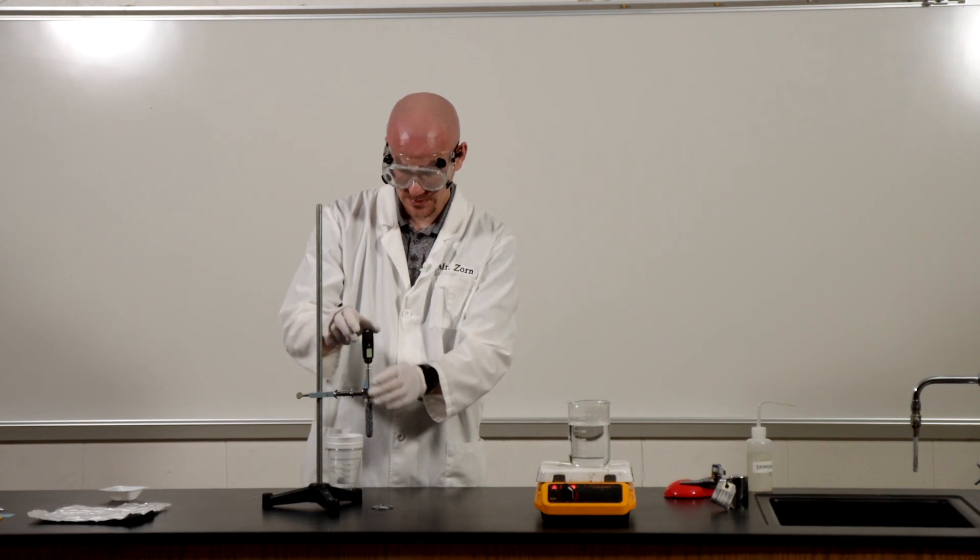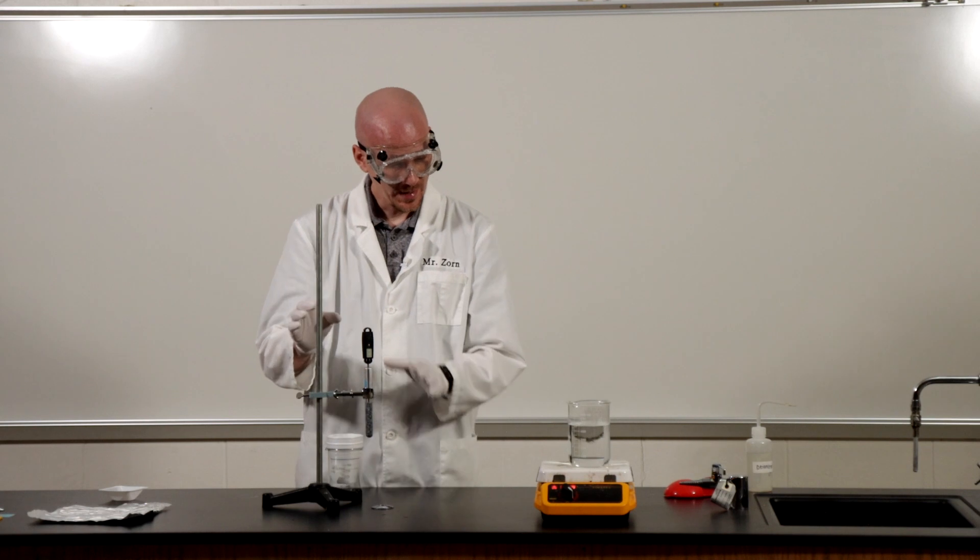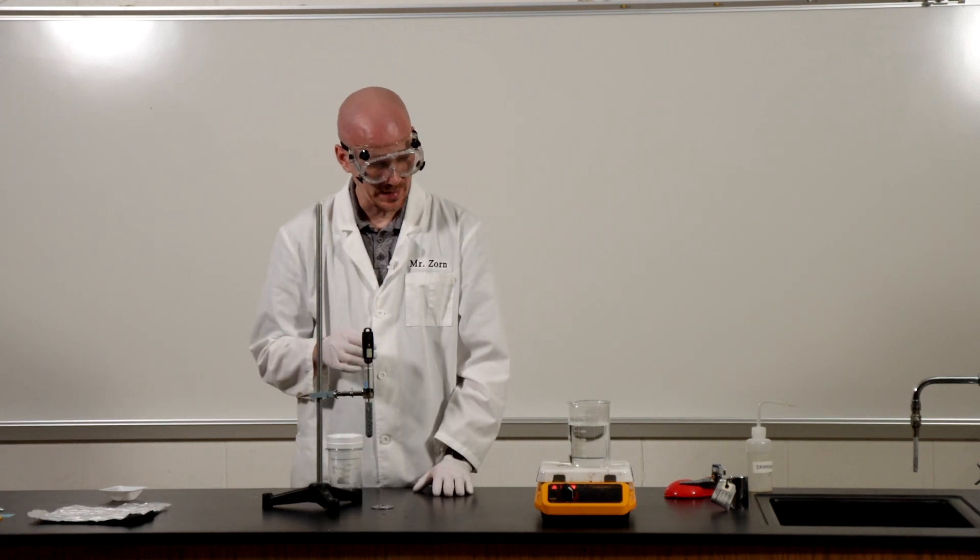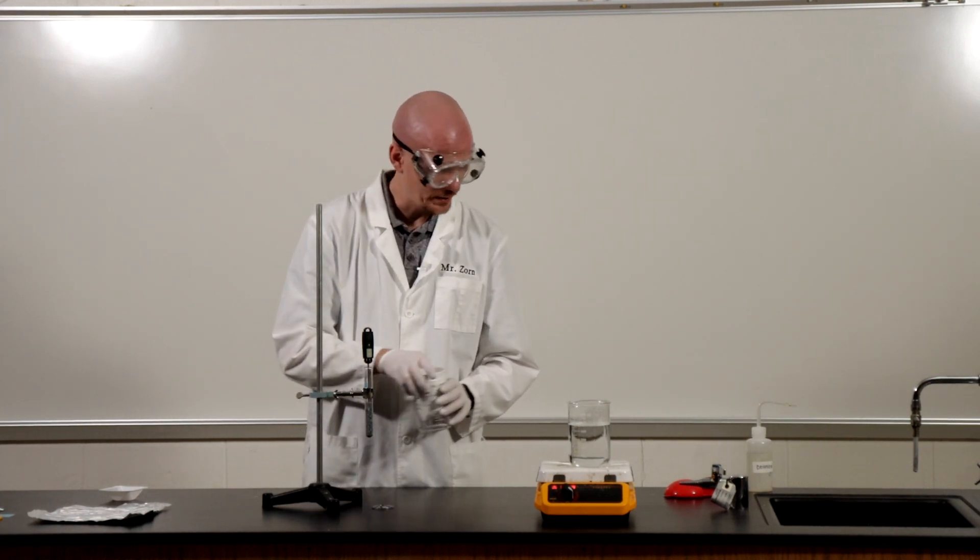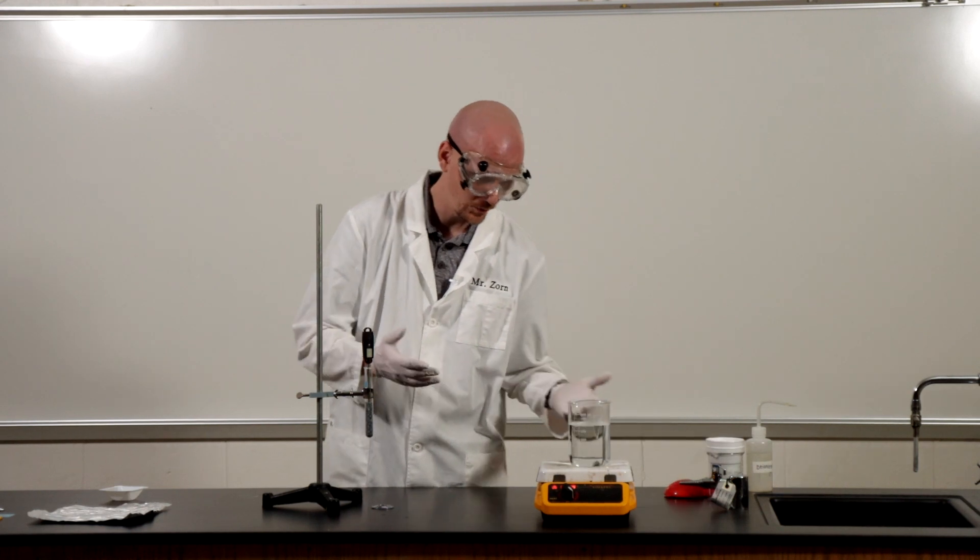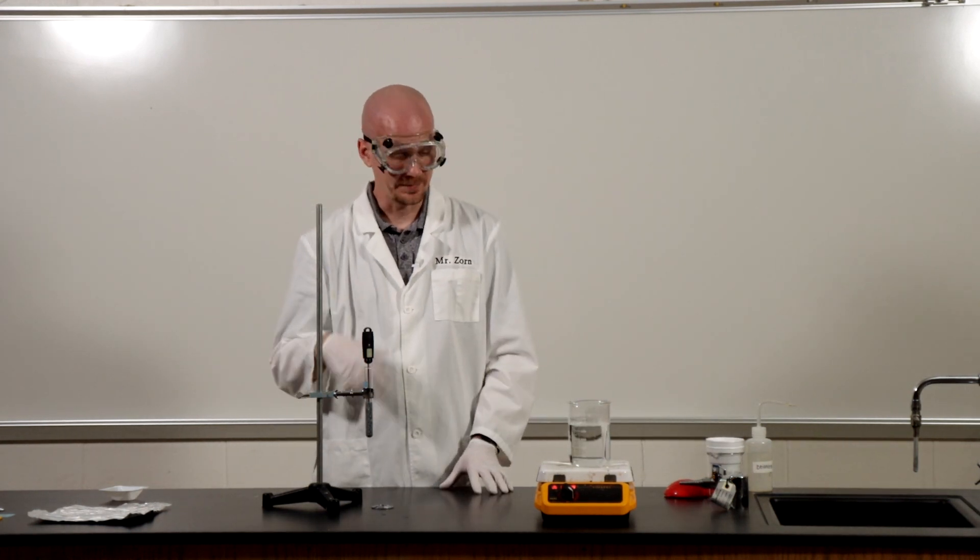I want to get a good idea of what the metal has been heated to so it's right in the middle there and then I'm going to put this in my boiling water here or it will be boiling here in a minute and we'll allow this to heat up.